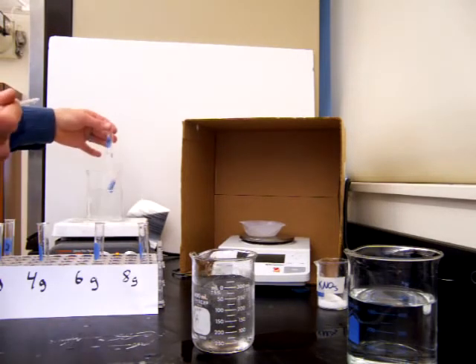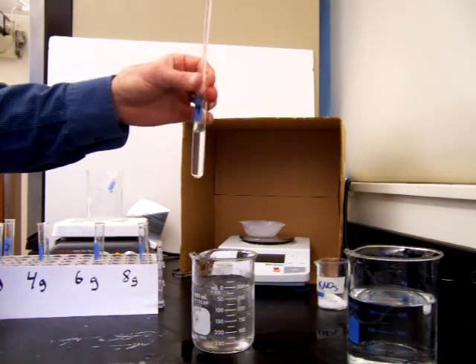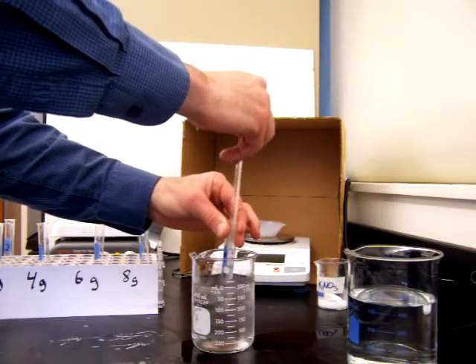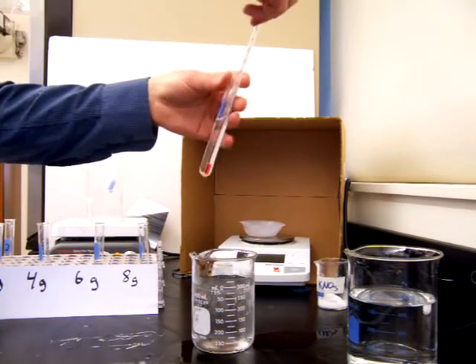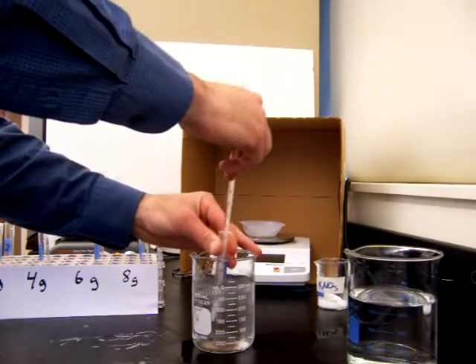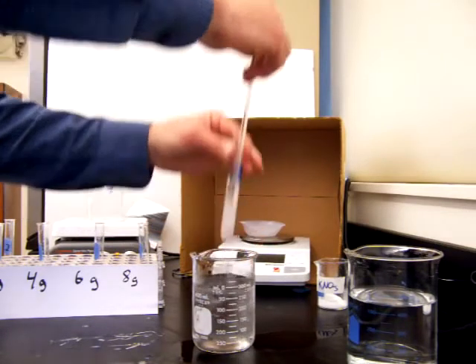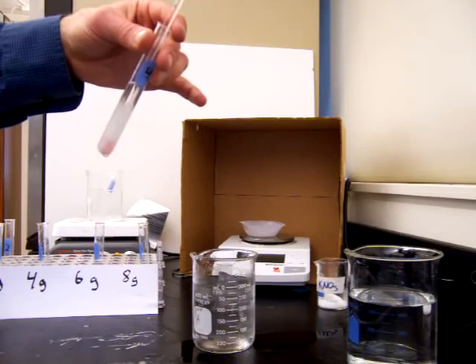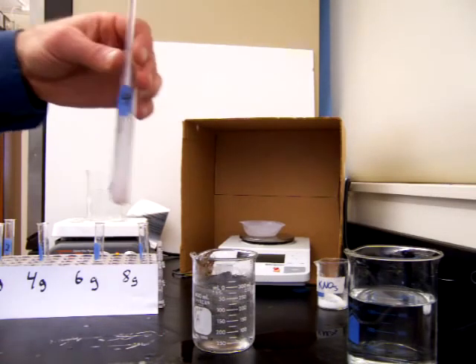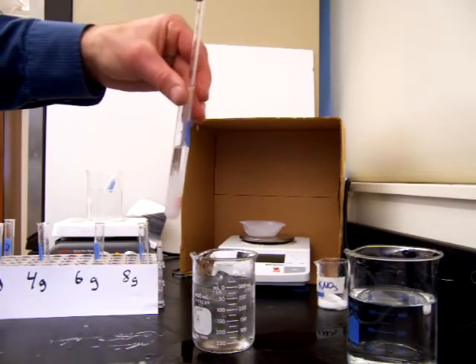All right, next we'll do the one with 4 grams of salt. So this solution has 4 grams of salt. And we'll do the same thing here. We'll stir it and cool it. So far, no salt particles are visible. It's still a solution. And as we cool this down, we'll eventually reach the point where the crystals form. There it is. And that one occurred at 47 degrees Celsius. So at 47 degrees Celsius, the solution with 4 grams of salt in 5 milliliters of water started to crystallize and came out of solution.